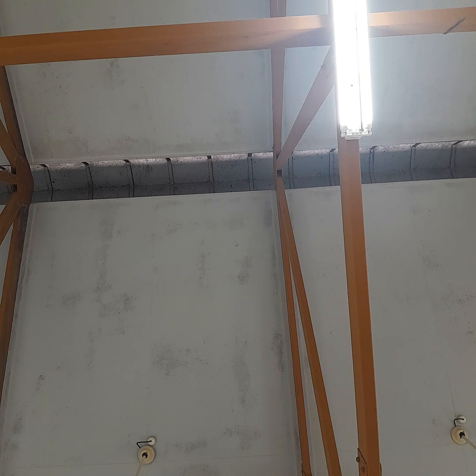Right, I believe everyone is paired. Anyone without a pair? Yeah, you work with her. Come. Yeah, you have your electrodes. Do they get the card for the bar? Yeah. So bring your ID card. I'll issue you the bar. Yeah, you bring whatever you have. Get going. Do you have anything?